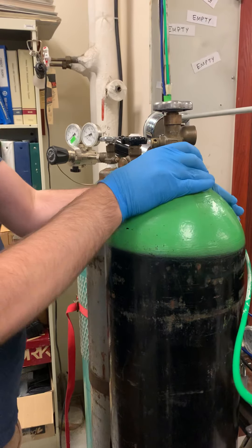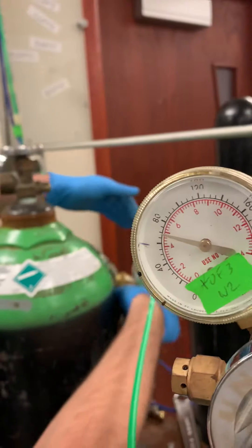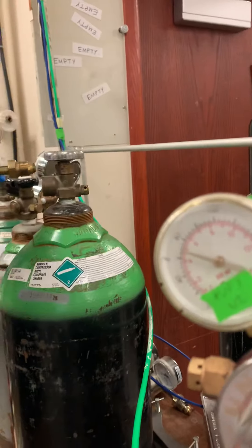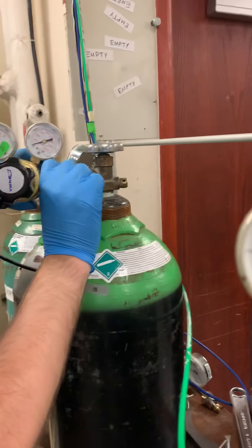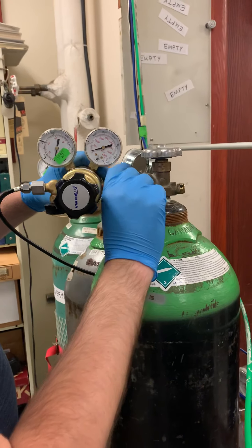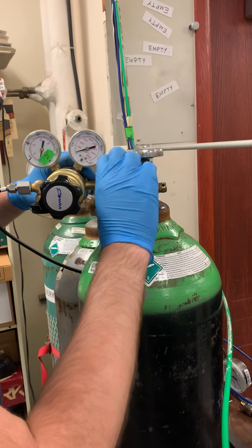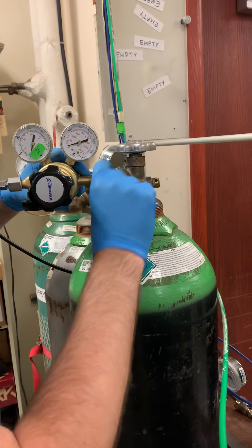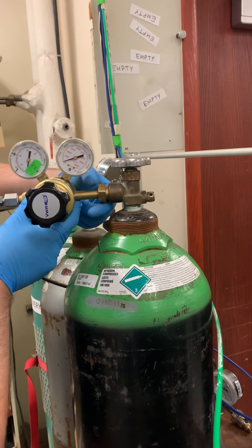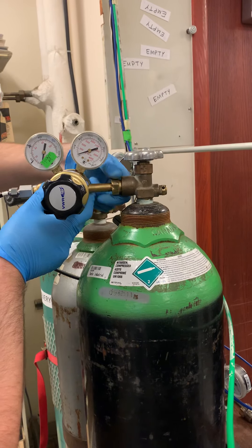Put it into position. I like to have it positioned so that I can see the pressures from the sitting position at the instrument. This screwing in is quite easy, but it's really a lot easier if you can hold the weight of the regulator in one hand, keeping it straight — you can practically screw it all the way in. I only need the spanner for a little bit of the work.